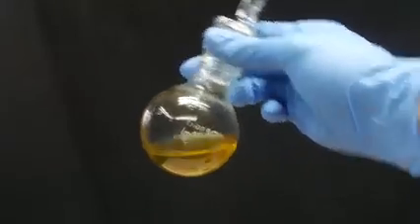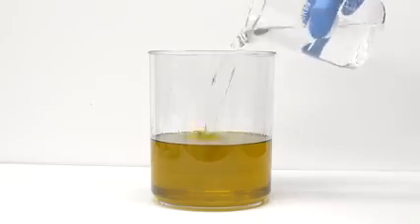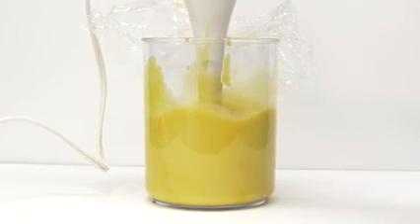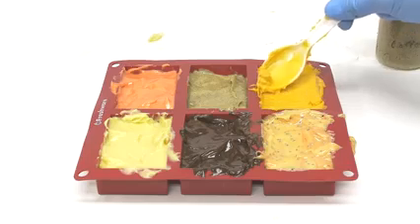In my mind, the fact that it didn't work here really just highlights how hard it can be to go in the other direction. Making soap is super simple, and we just throw some base and oil together, and boom, we get our salted fatty acids. Going backwards, though, the process is much more involved, and it's clearly more difficult to get going.